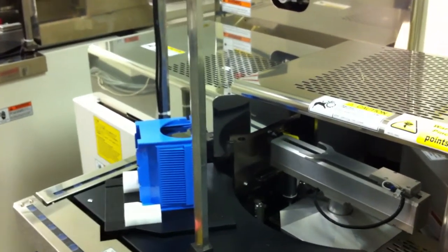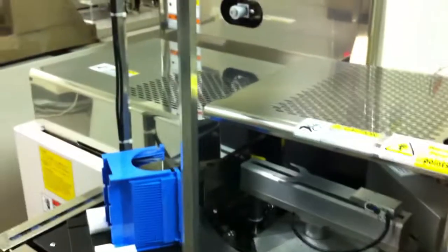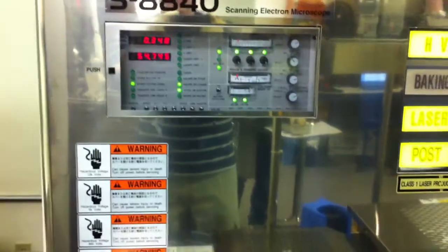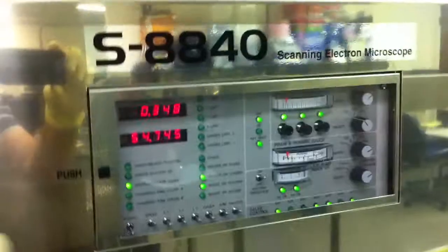The exchange chamber is going to start pumping down, and in a few moments it'll drop it into the main exchange chamber. We've got a very good vacuum up there on our ion pumps.